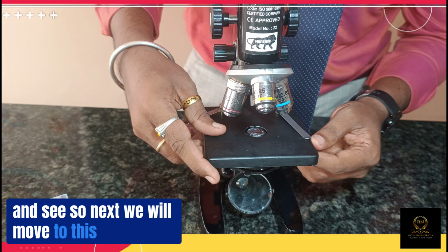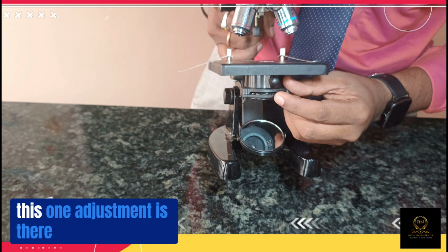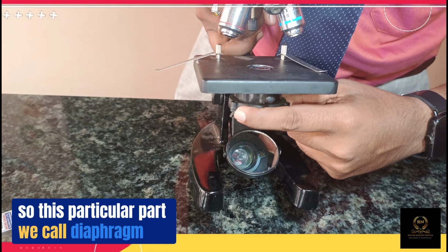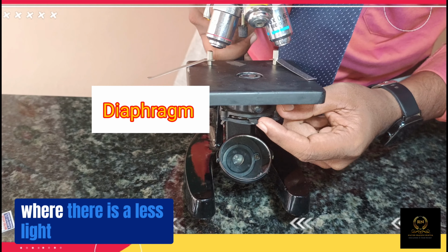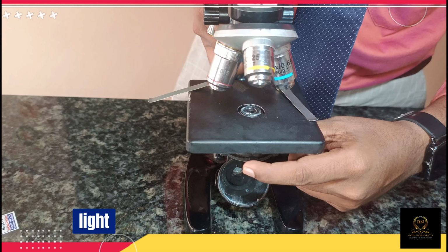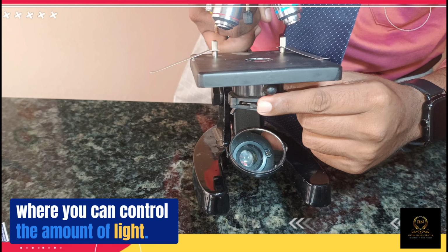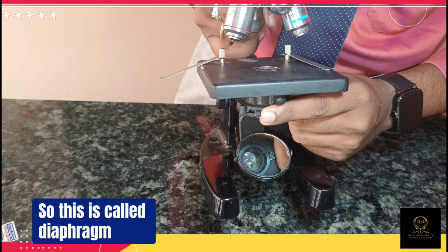Next we'll move to a very important part. You can see this adjustment here. This particular part we call the diaphragm. You can use the diaphragm where there is less light or more light. You can control the amount of light entering through the microscope, and this is the part where you control the amount of light. So this is called the diaphragm.